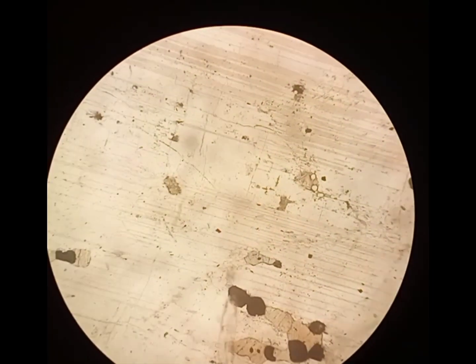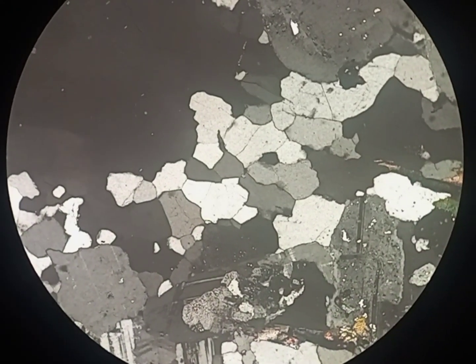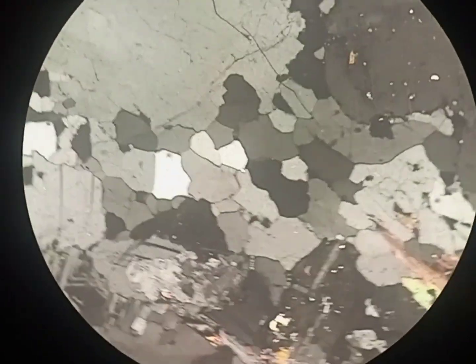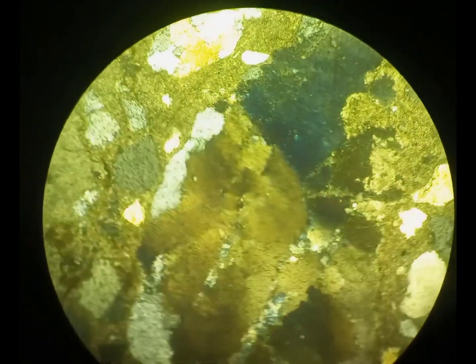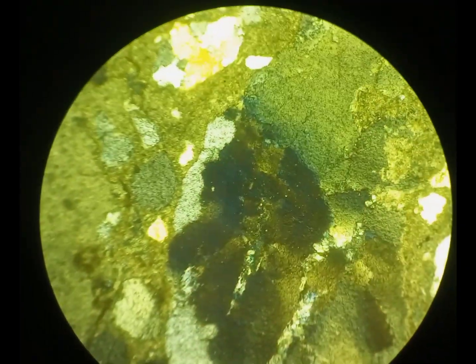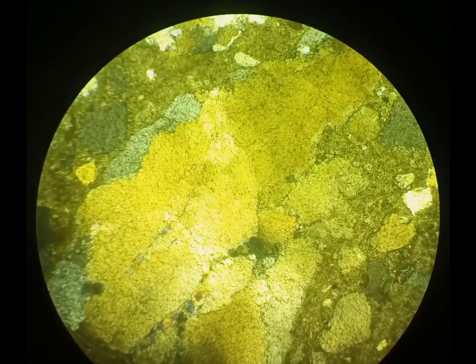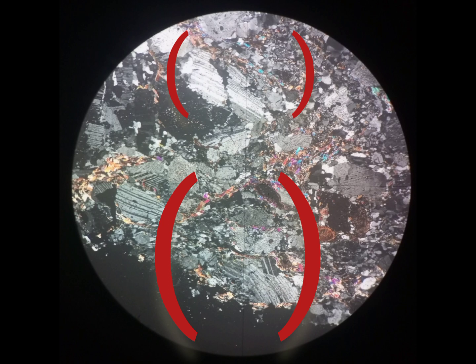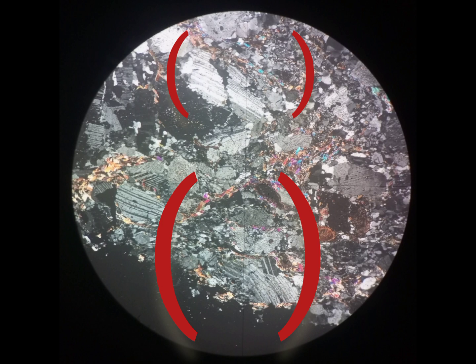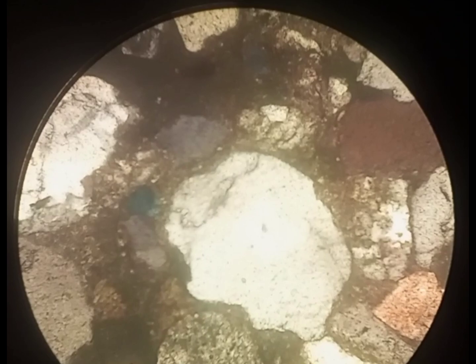When a quartz grain undergoes different kinds of forces, it becomes deformed. Strained and deformed quartz is identified by different kinds of fractures, undulose extinction, and polycrystalline growth of quartz, which we mostly observe in metamorphic rocks. On the other hand, when feldspar undergoes deformation, it shows plastic deformation, as we can see in this thin section.